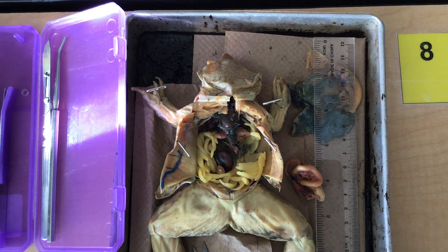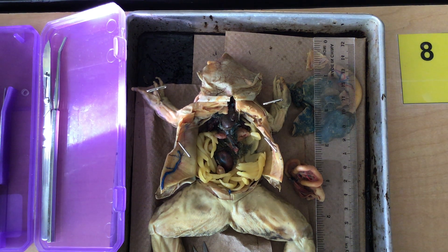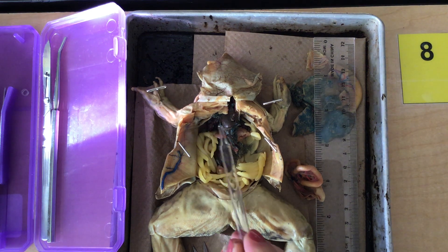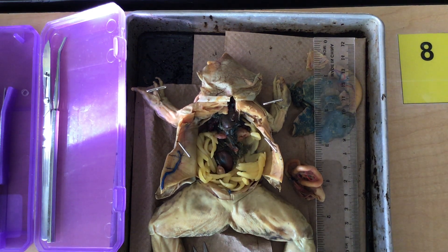Locate the two reddish-brown sack-like structures, which are the lungs. They should be on either side of the heart, kind of towards the back.